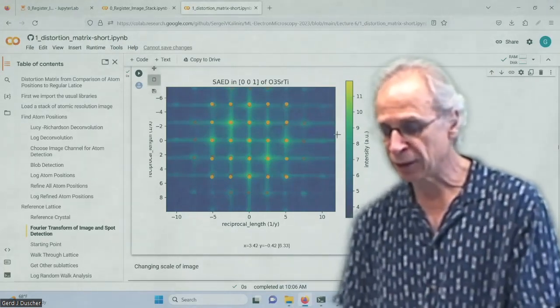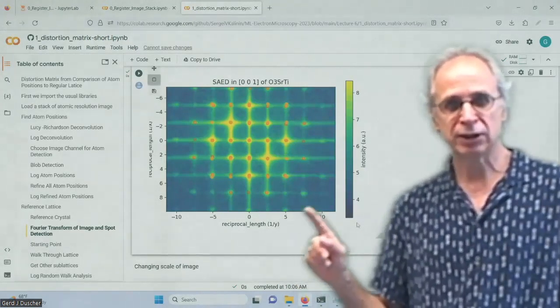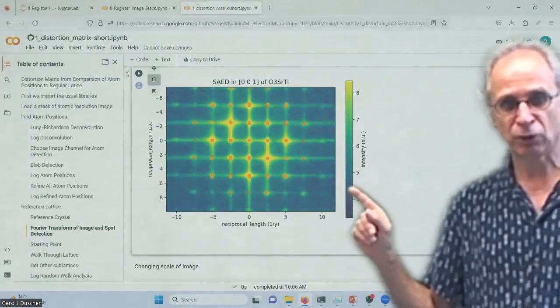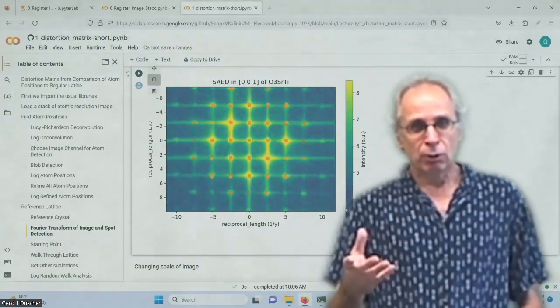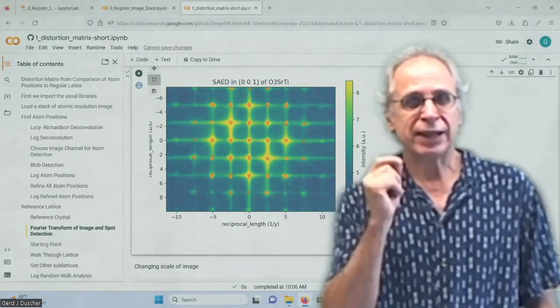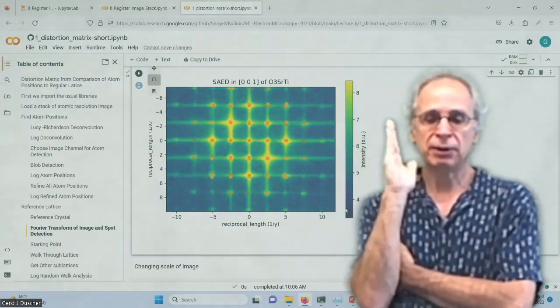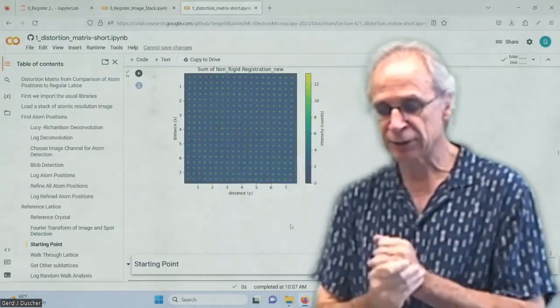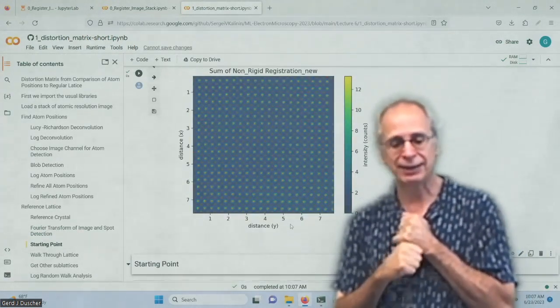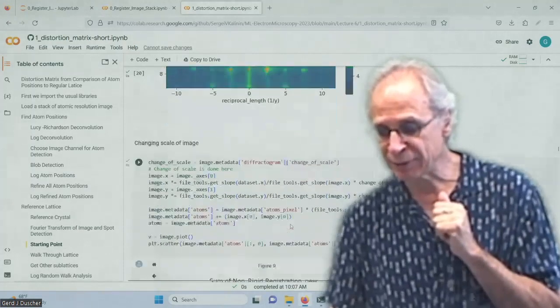And again, this is just matplotlib. So you can use the color bar and change your positions and intensities around. So, what did I gain with that? I got my rotation. So I know in which orientation my unit cells are. Let's go through that. And I know actually what kind of scale we have, and I change my scale accordingly. Again, we did that last time.